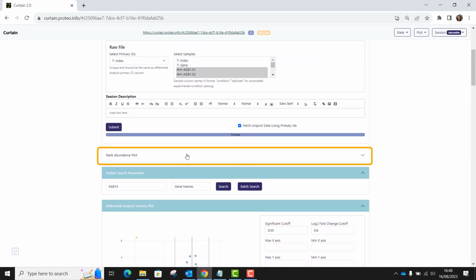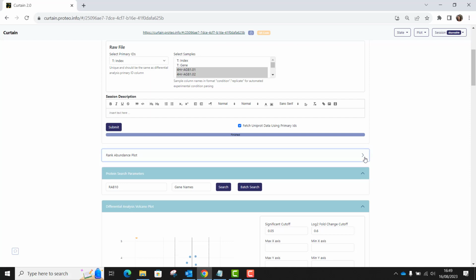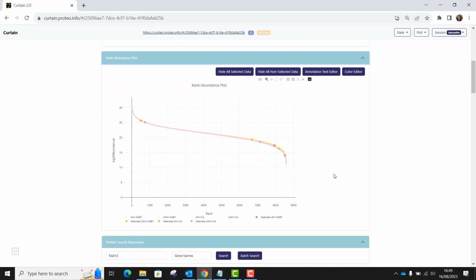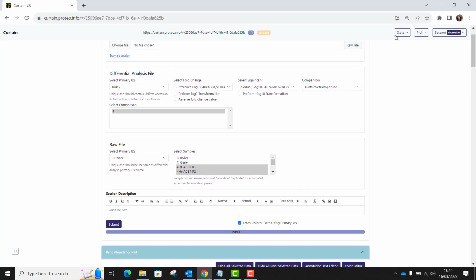Curtain also generates a rank abundance plot here, which is initially minimized, but you can open it just below the submit button. This shows you all the proteins in the dataset arranged from most down to least abundant. If you hover over any protein in the dataset, you will see its rank and log2 transformed abundance next to it. Any proteins which you have selected in the volcano plot also appear as little dots along this rank abundance plot.